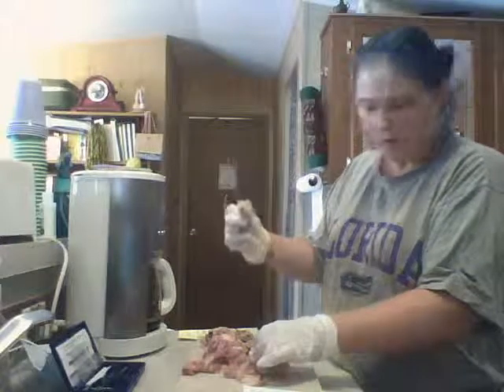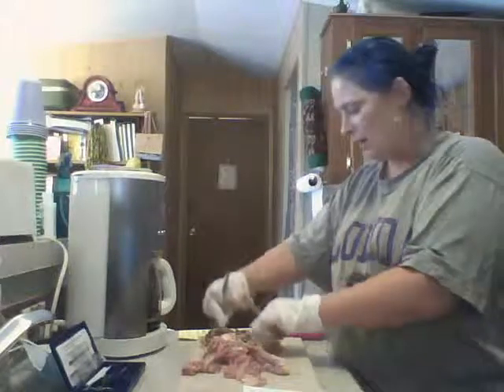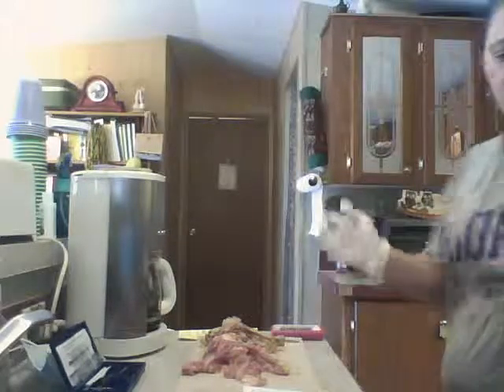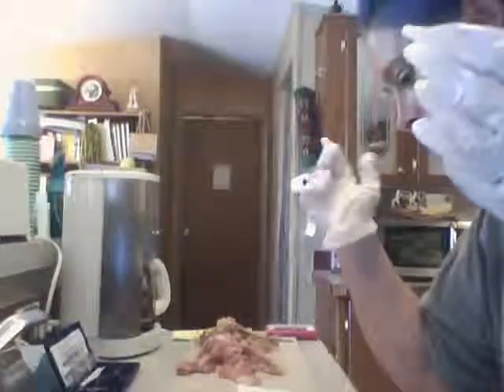Fibula on the outside or inside. Let's see.